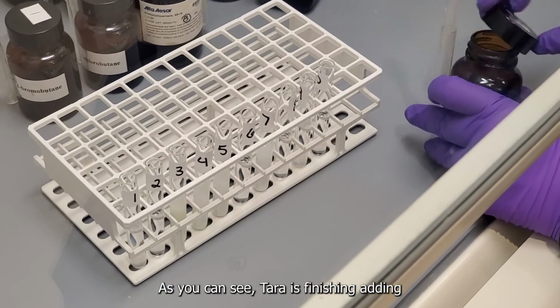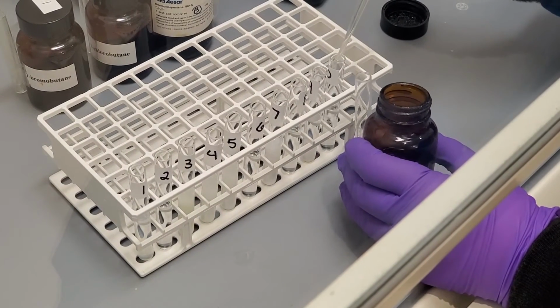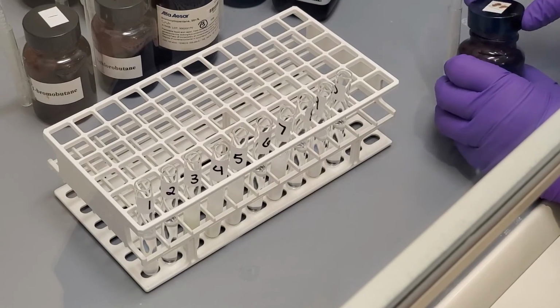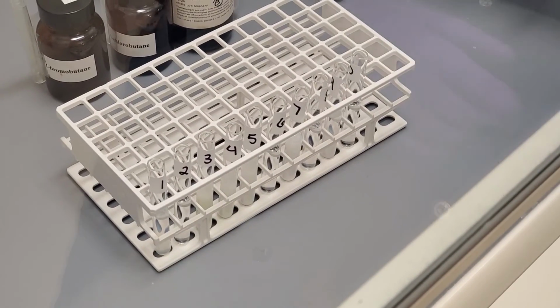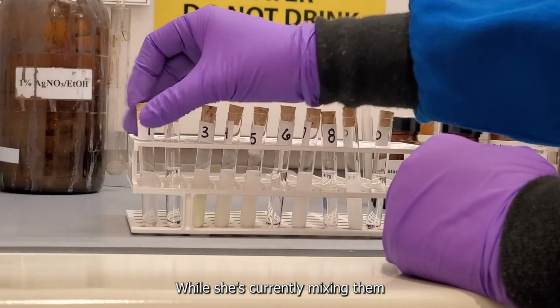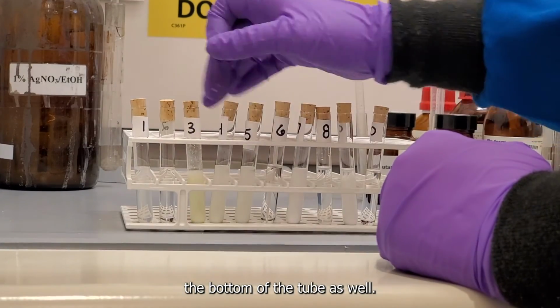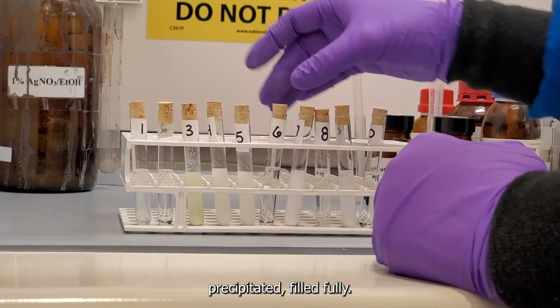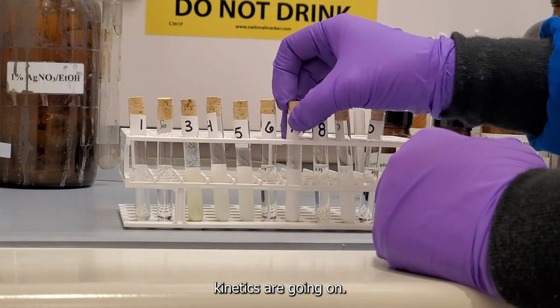As you can see, Tara is finishing adding, and you can see some of the reactants have already precipitated. This is before mixing. We'll show you a quick close-up of them right after mixing. So now they've been mixed, and you can see Tara currently mixing them, holding the cap down and inverting them. The other way I mentioned was to tap the bottom of the tube as well. And as you can see, not even 5 minutes have passed, and about 4 or 5 of them have already precipitated fully. So you can use this information to discern what type of reaction kinetics are going on.